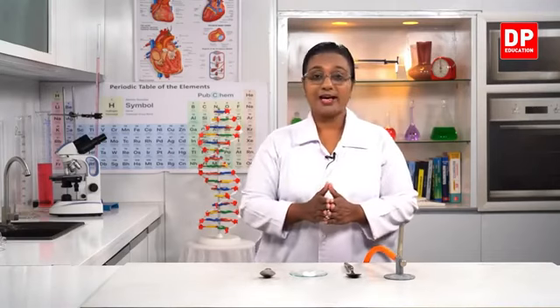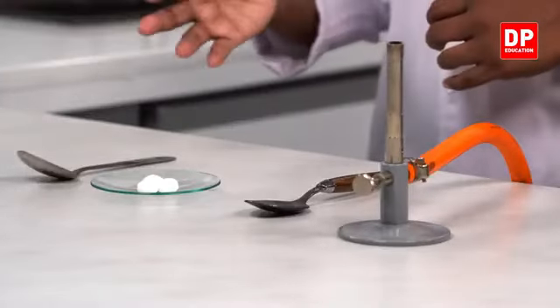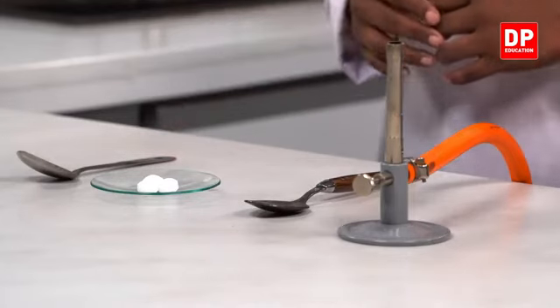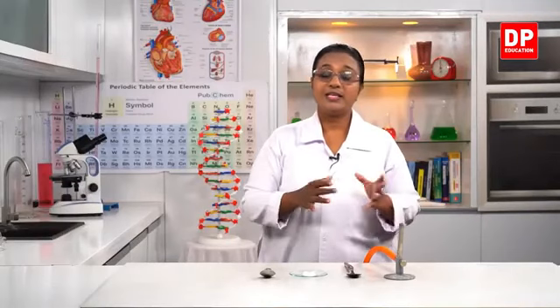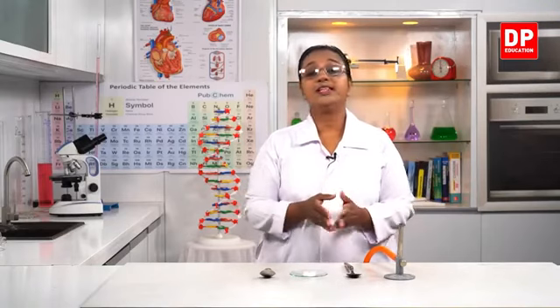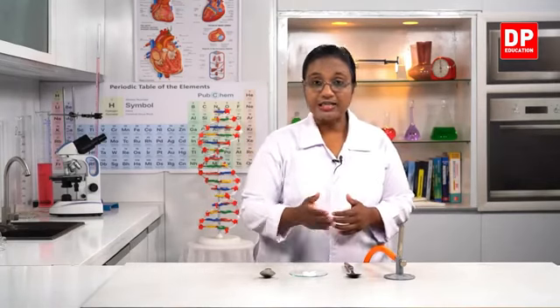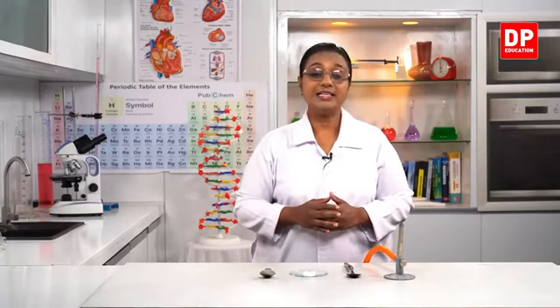So to start the activity, I have naphthalene balls, or what we call as mothballs in common terms. You can see the mothballs here. Now you know this is a white color pebble-like or pellet-like structure. You have used this at home. Now if we take the mothball, we leave it in a place for about few weeks, you won't see the mothball anymore. What happens there? The mothball goes into a different state. Now here the mothball is in the solid state. It can go into the gaseous state.